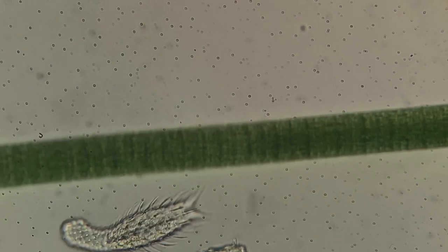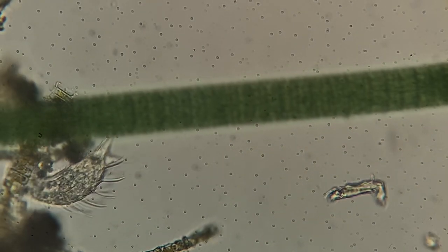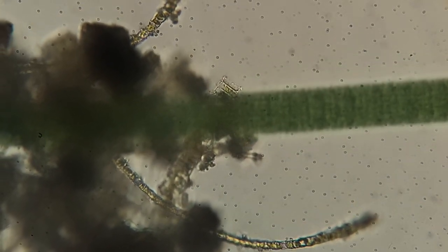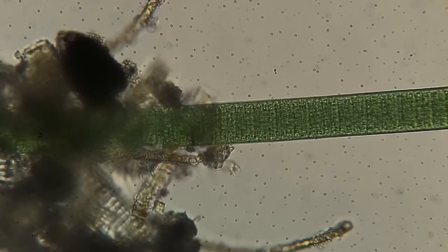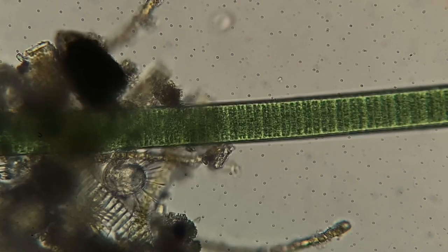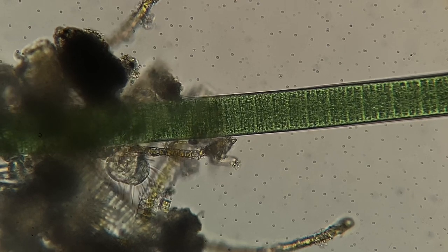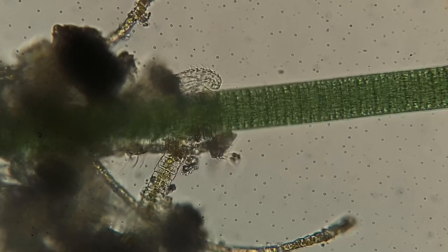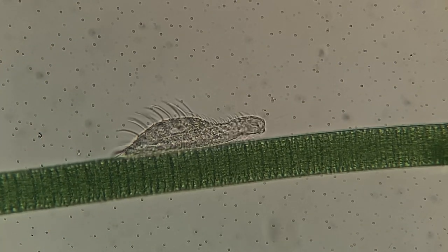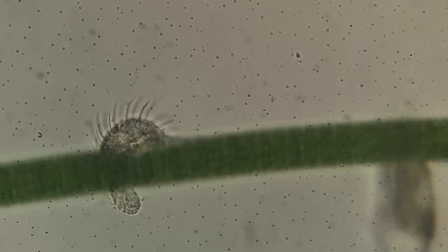Now let's go ahead and change gears. For the rest of the video I want to talk about these gastrotrichs. We're at the same magnification we were using looking at that stentor zoomed in — about 400 times magnified, plus or minus about two times with my phone. Now despite being so small, these creatures are actually a lot more closely related to us than the stentor or the cyanobacteria, and the reason we know that is because they're multicellular.